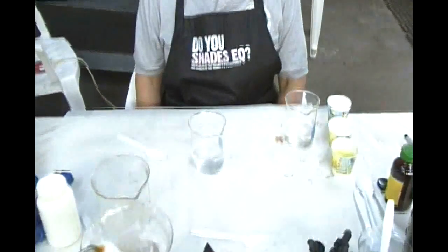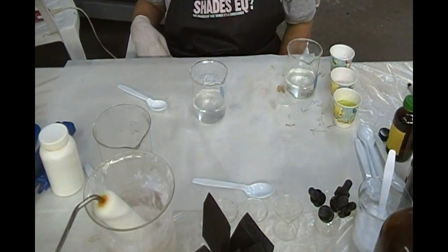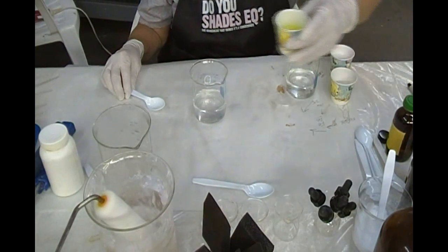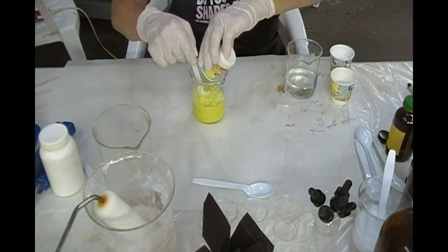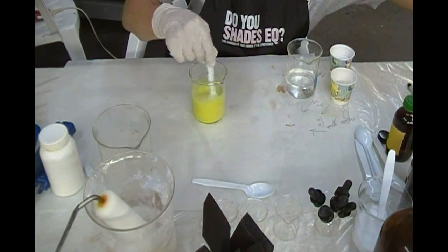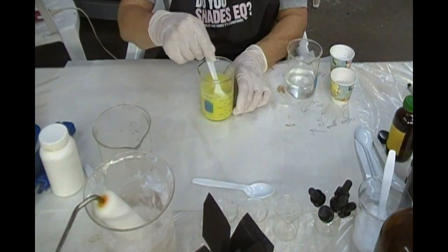I'm using Maddie to mix up some guanidine ferric oxalate. She's going to follow my instructions and I'm going to zoom down so we can see what she's doing. The first thing Madeline is going to do is take 26 grams of ferric oxalate and put it into 100 milliliters of water — distilled water, although it's probably not necessary. This is standard ferric oxalate. Bostick and Sullivan is known for making a very pure, oxalic acid-free ferric oxalate.